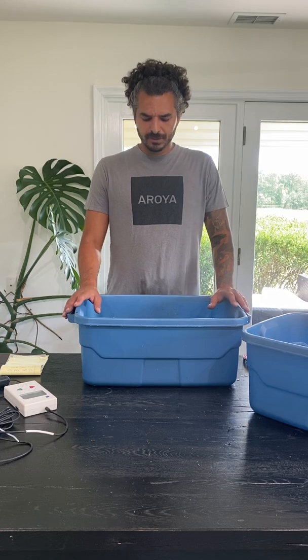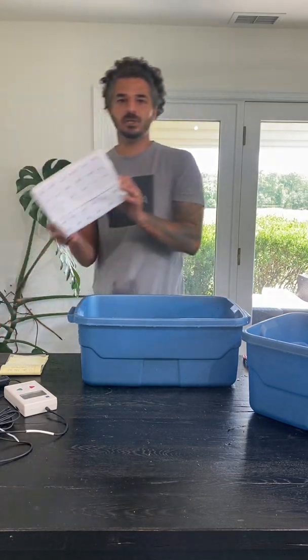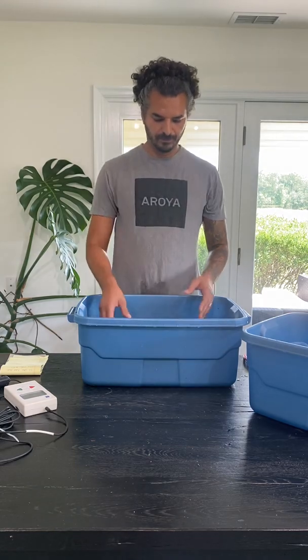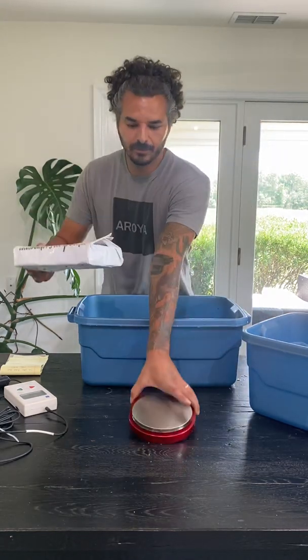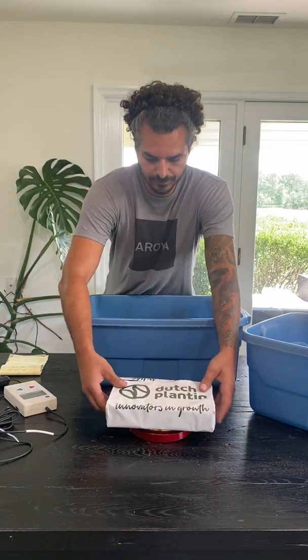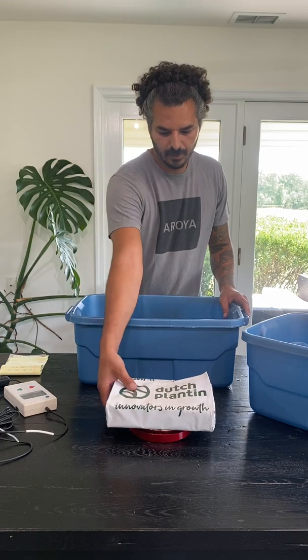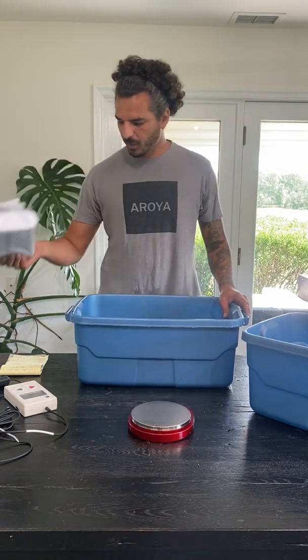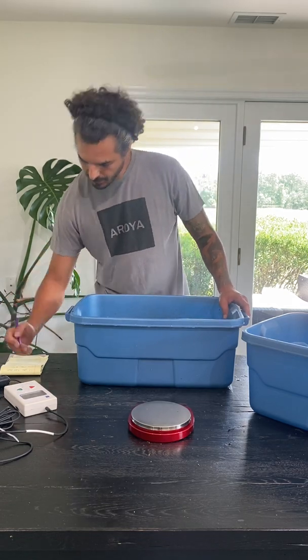So what we're going to do to run this experiment is we're going to take the pre-dehydrated substrate and first weigh it out. I'm going to use the scale and weigh this out. In this case, this substrate weighs 899 grams. So I'm going to write that down.